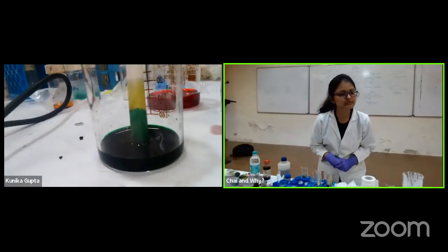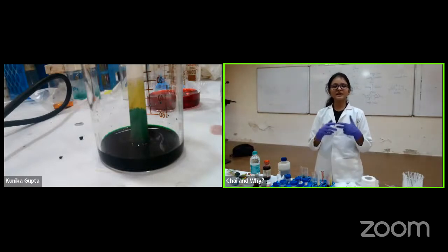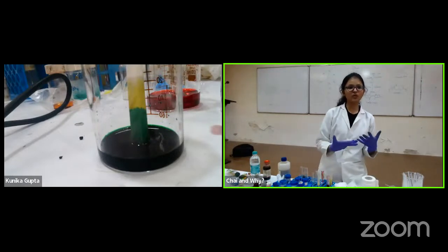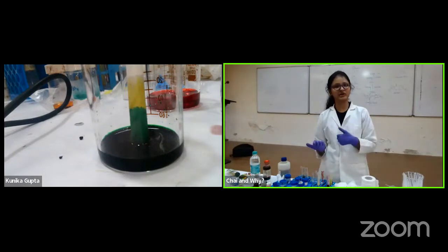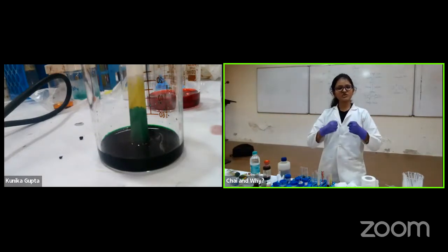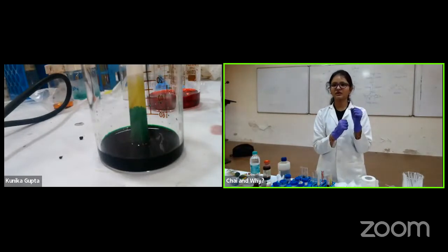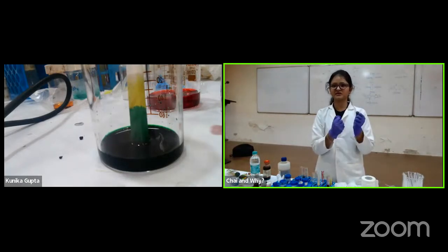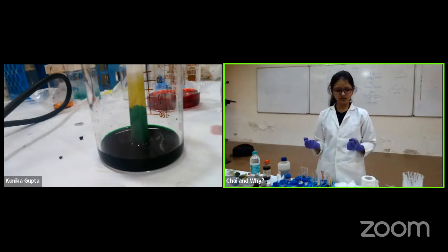There's a question. Naitik is asking why the yellow color moved faster than the green. Exactly, that's what I told. It is about the solubility. The yellow was more soluble in water, and hence it moved very fast compared to green. Green was moving slower and yellow was faster, so yellow went ahead and green is coming behind. They both are moving because you have forcefully made them participate in a race. So they both will move, but that depends upon their speed. The natural property you just can't change, right?